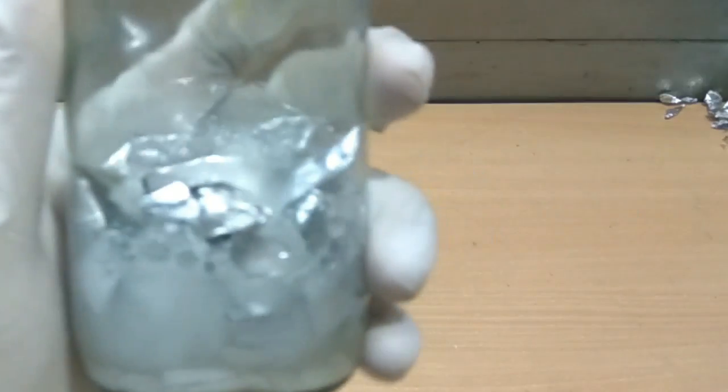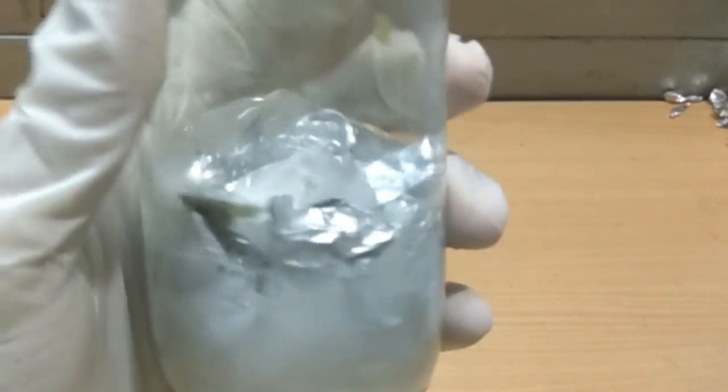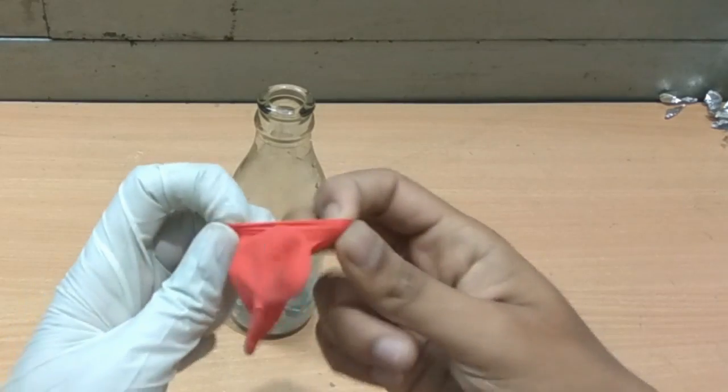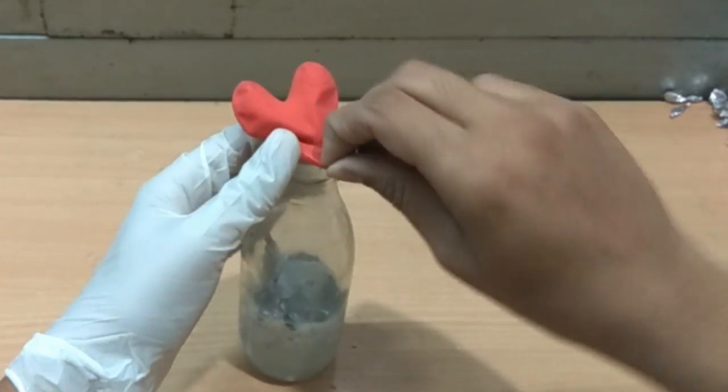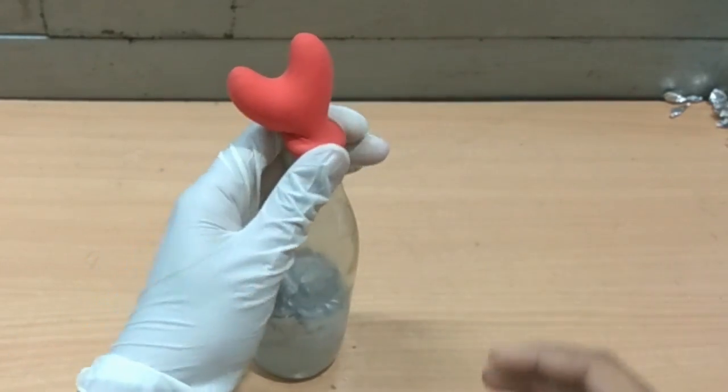Within few seconds, the mixture starts bubbling and you can see these bubbles are the hydrogen gas. I'm using a balloon to capture the hydrogen gas. Just after placing the balloon, you can see how rapidly the reaction is taking place using only a small amount of reagents.